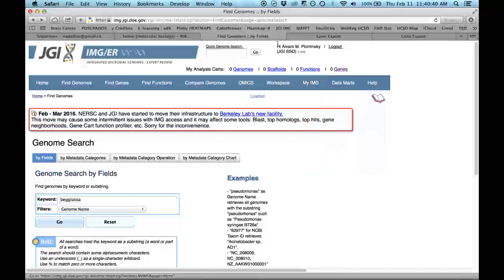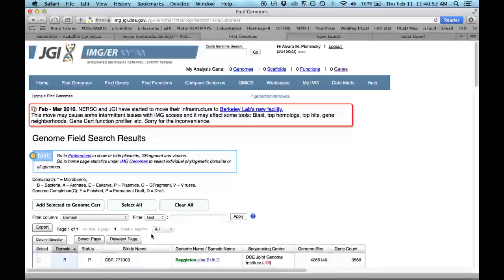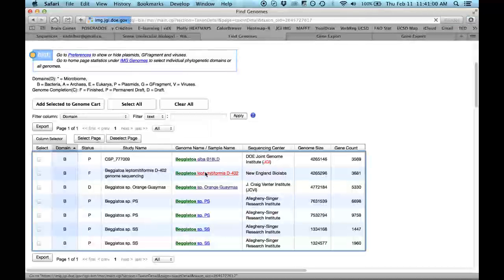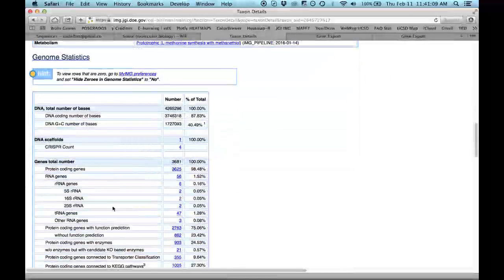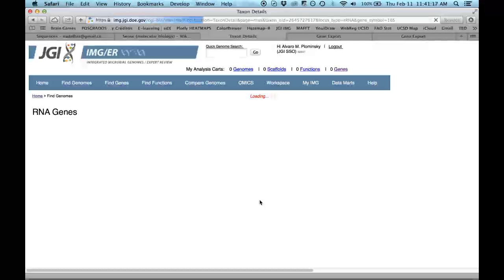When you enter your login, you can look for the keyword. Here I will put Beggiatoa and go. And it shows you several ones. The one that I chose was this one. Here you go down and you can go to the 16S RNA. Here you click on the number. It's charging. It will take a while. Let's charge it again.